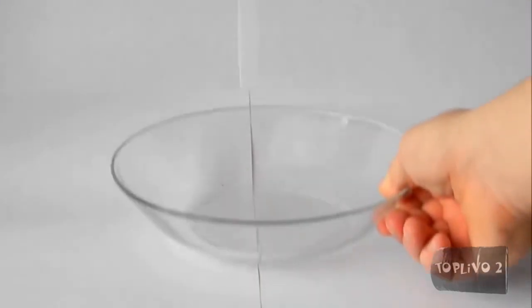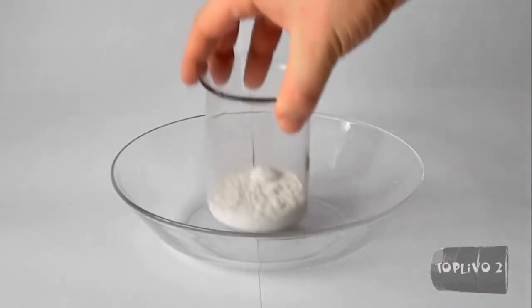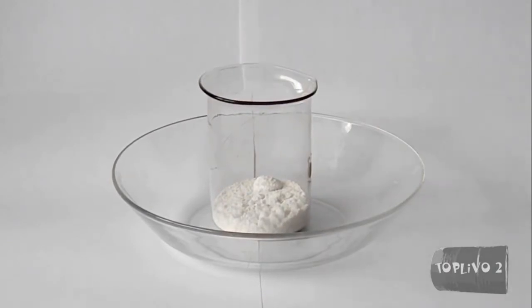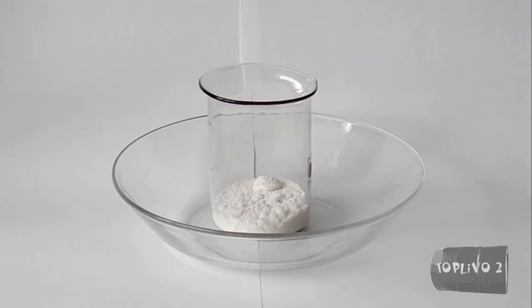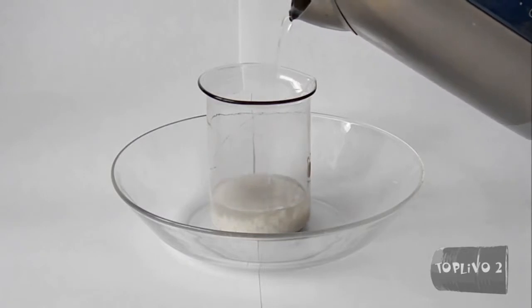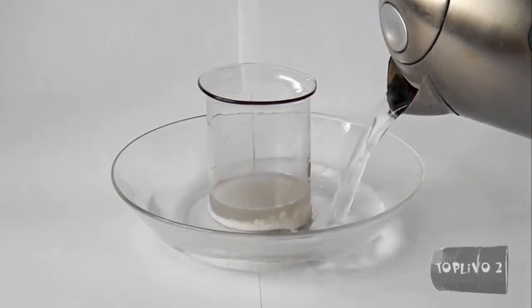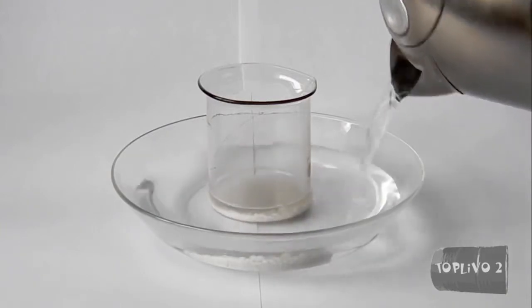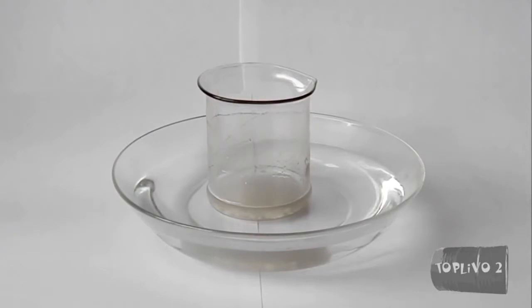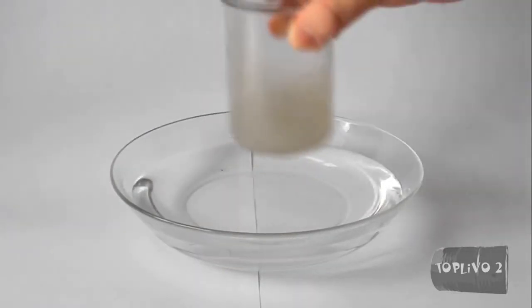Those who do not have access to 30% or 50% hydrogen peroxide can make it from hydroperite. Here we have a cup of 25 crushed tablets of hydroperite. They will now be dissolved in water — fill with a small amount of hot water and also pour hot water into the bowl so it can warm up and mix. Stir until the hydroperite is completely dissolved. Now we have a hydrogen peroxide solution of about 25%.